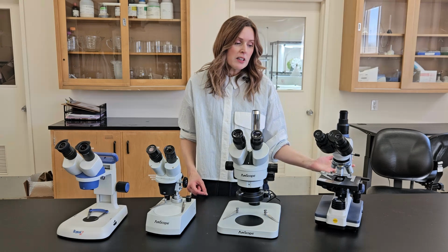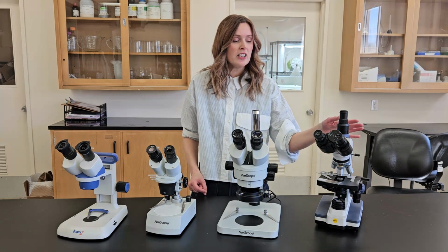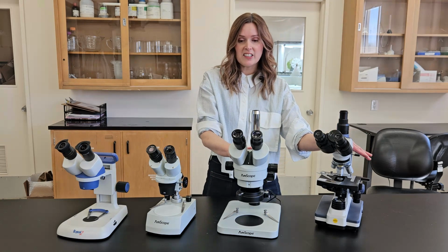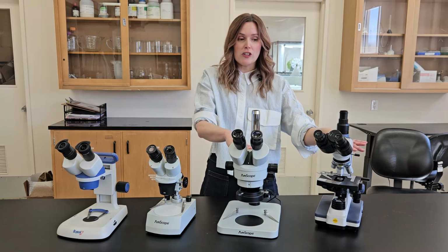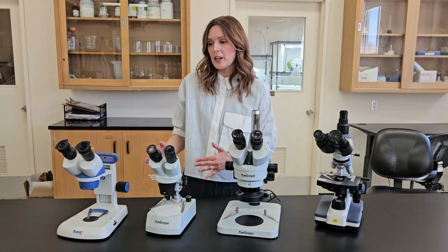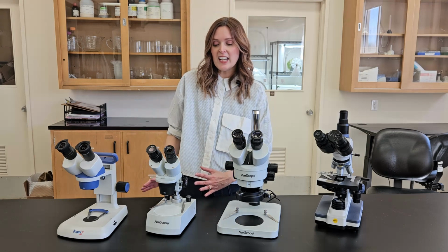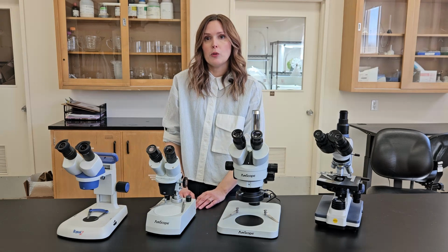So if you are doing a lot of thrips identification on your farm, or maybe mite identification, then absolutely a compound scope and the dissecting scope together for around $1,000, even with an external light source, I think is totally worth it. If you don't have that budget right now, or you think you're going to be using them in the field a lot or transporting them to different sites, then these $200 to $300 ones will serve you well.